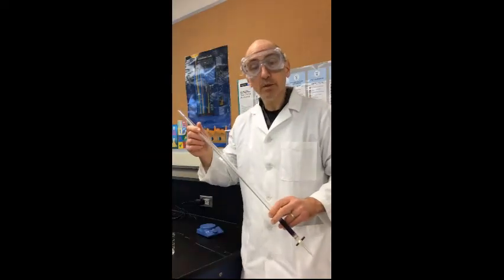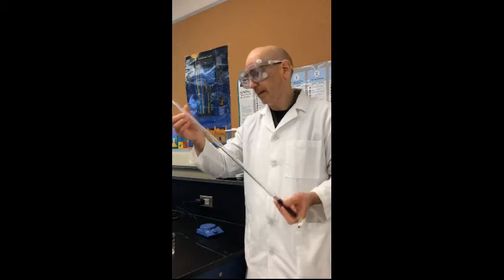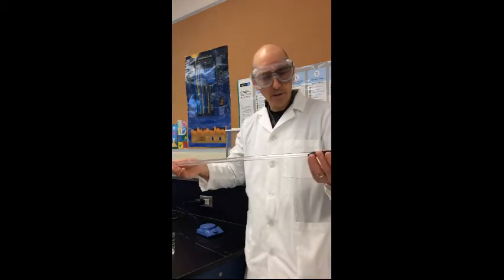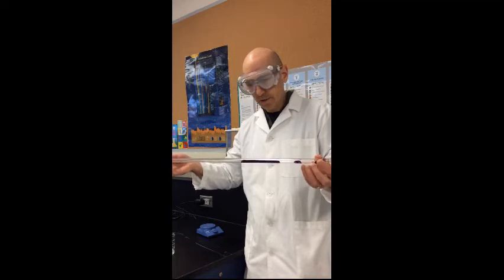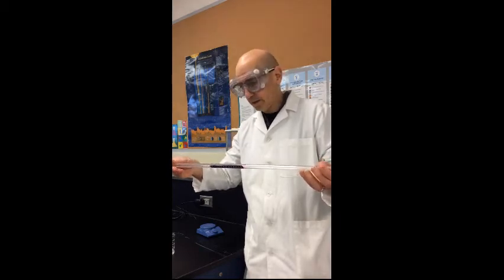Before we titrate the ferrous ammonium sulfate, I went ahead and rinsed out this burette with distilled water. Now I'm just kind of clearing it out with some of the solution that we will be using to titrate. So this is the potassium permanganate solution. It's a really nice purple color. And here what I'm trying to do is make sure there's no droplets of water that are going to dilute this solution when I start putting it in.